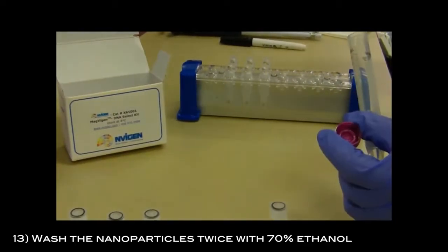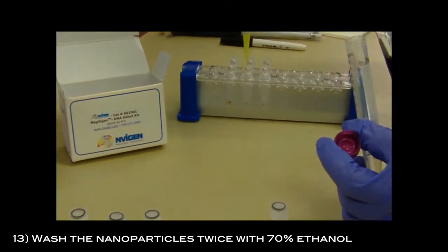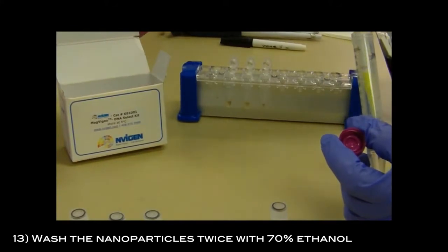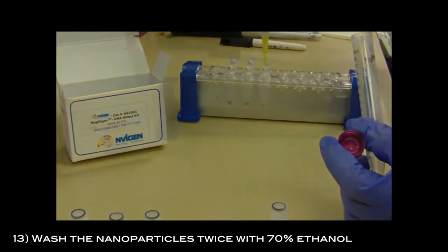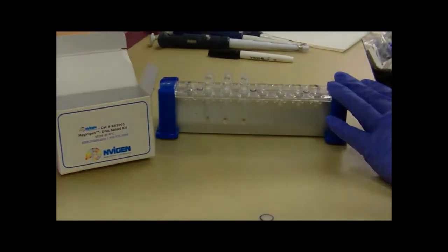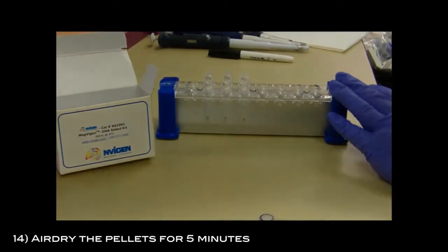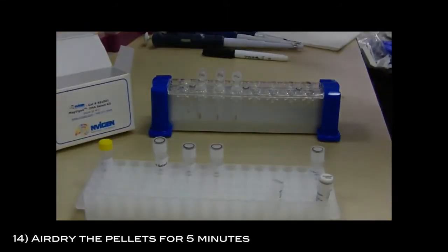Wash the nanoparticles twice with 70% ethanol. Air dry the pellets for 5 minutes.